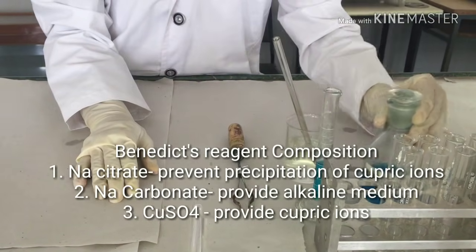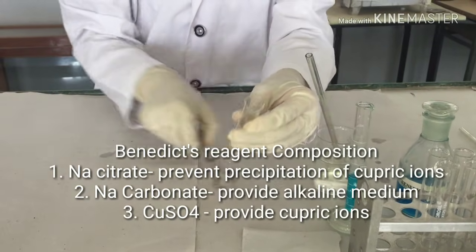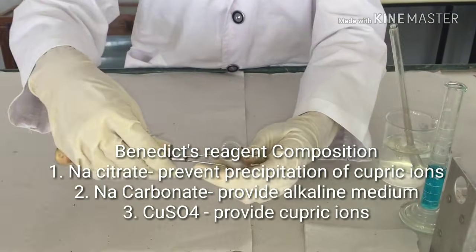The reagent used for this test is Benedict's reagent. Take a test tube and hold it firmly with the test tube holder.